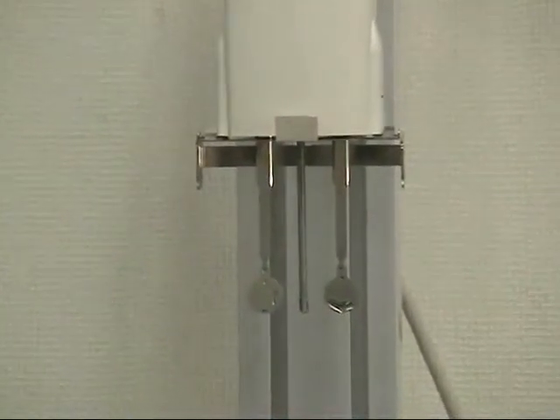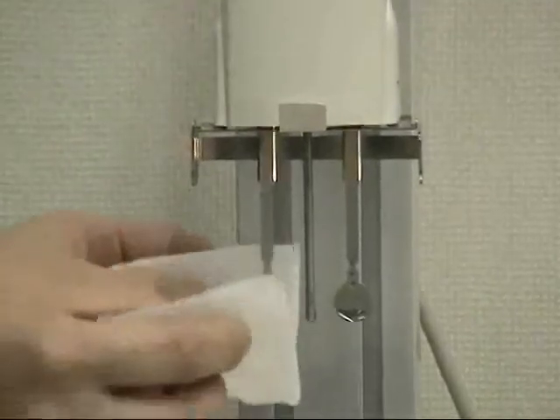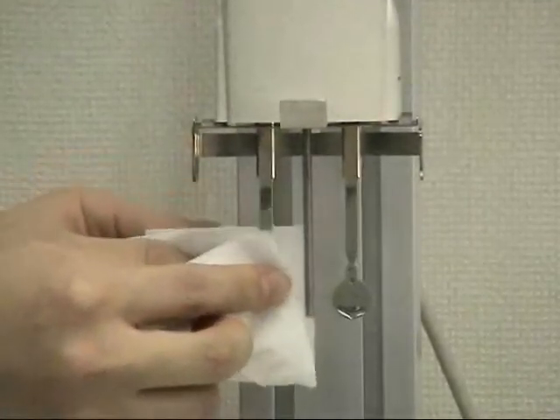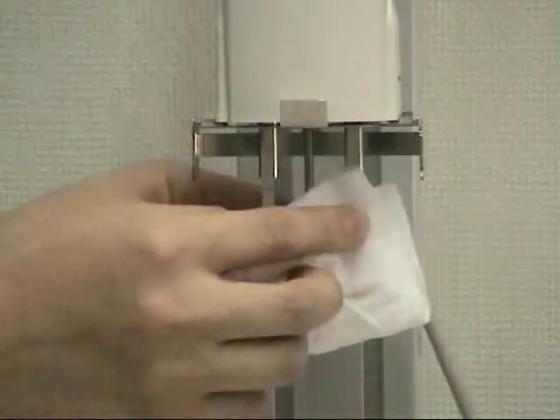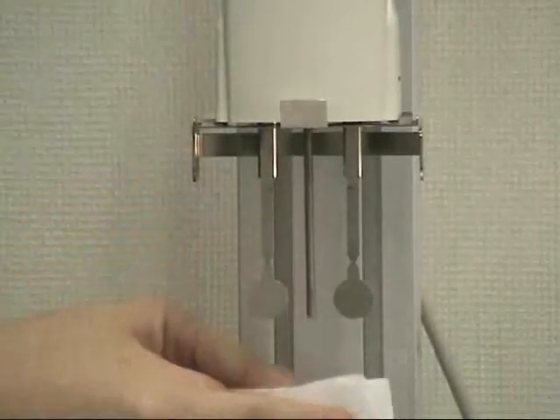Hold the sensor plates or temperature sensor with tissue paper. Move the tissue paper downward to remove the residual samples.